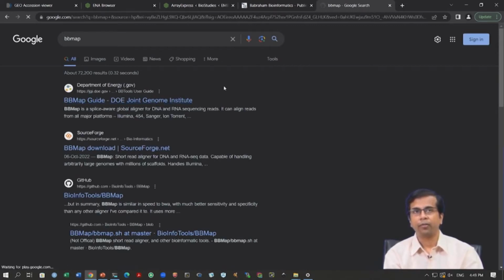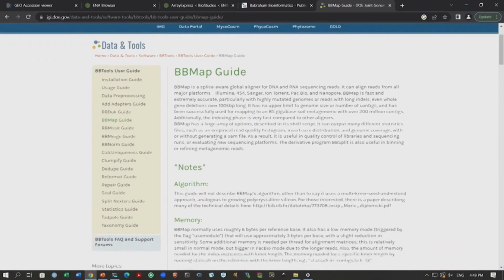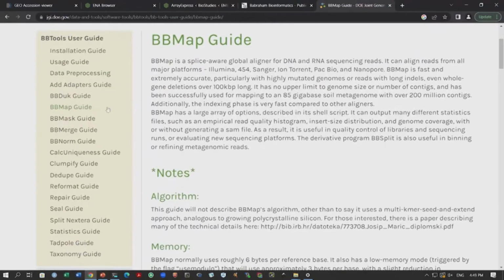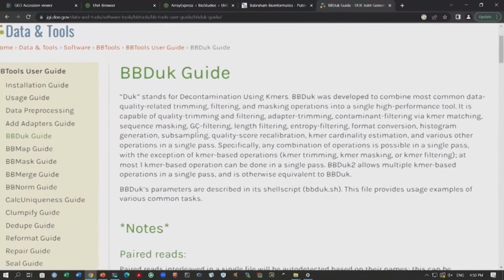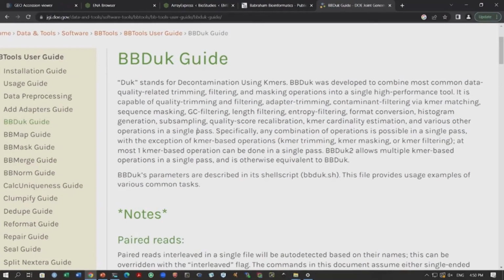Okay. So, we can go into BBMap, right, and we can download and extract this BBMap. Okay. And if you can see on the left side, I will zoom in a bit. On the left side, you can see you have this BBDuk, right. So, BBMap has a lot of functions. I will not go into all those, right. So, I will just simply look at this BBDuk because this is the function that is useful for us. Okay. So, you can see there is an explanation, a lot of details, how to use this tool, what are the options, what are the command lines, what is the algorithm that this tool uses.